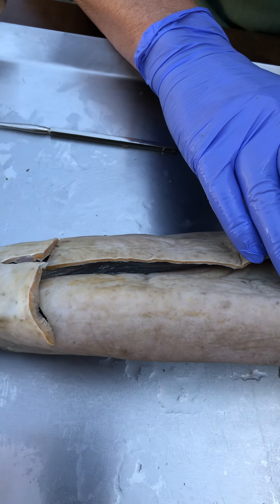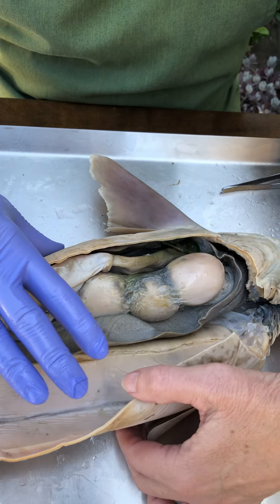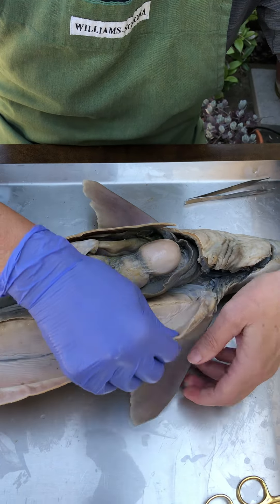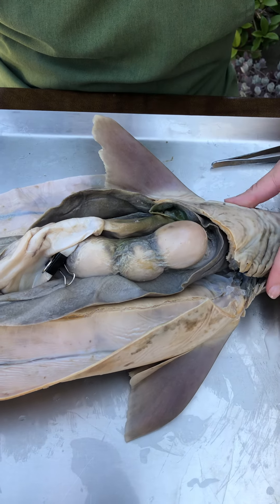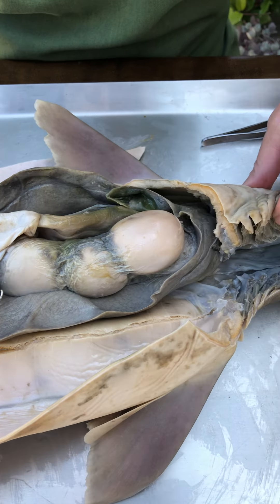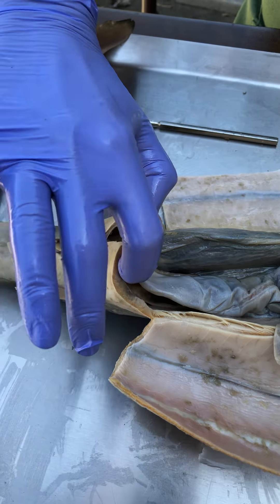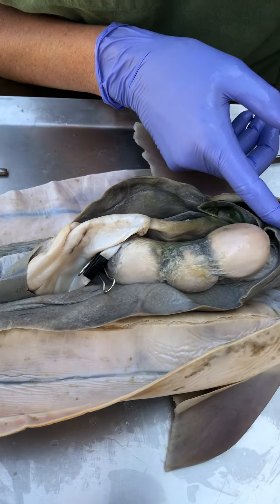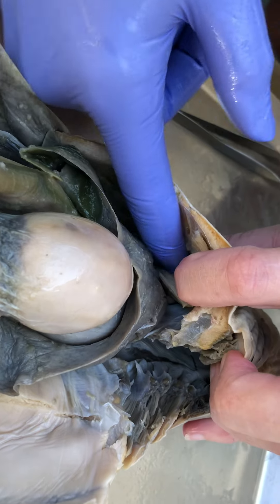And then when you do that, what you can do is pull back the body wall. We're actually looking then into the peritoneal cavity, which is bounded on the posterior end by the pelvis and on the anterior end by this structure here called the transverse septum.